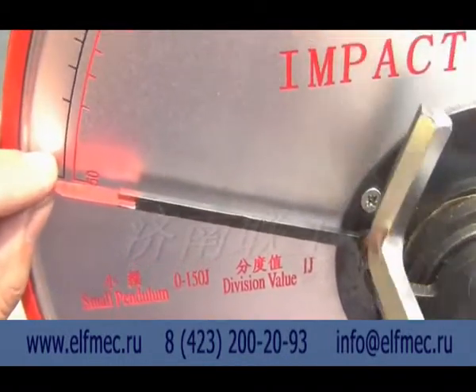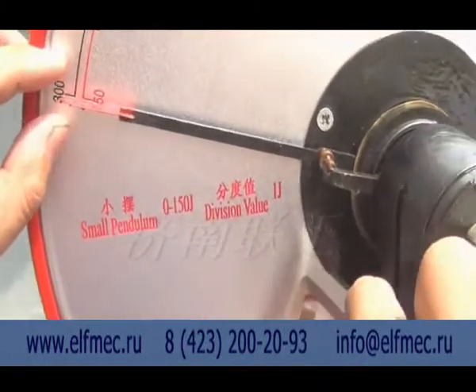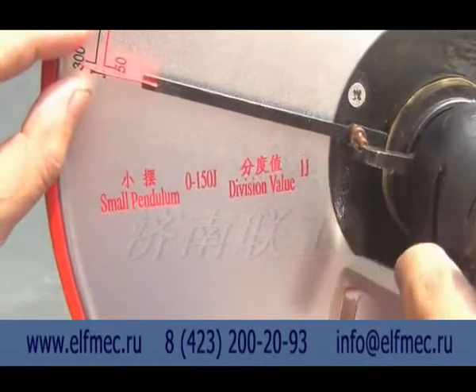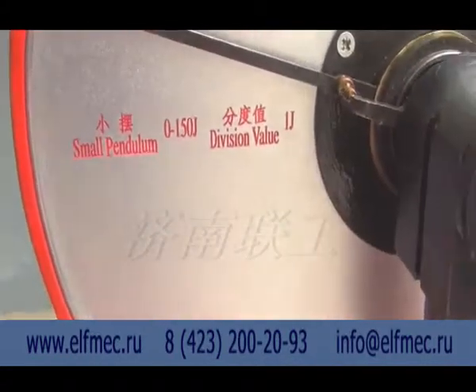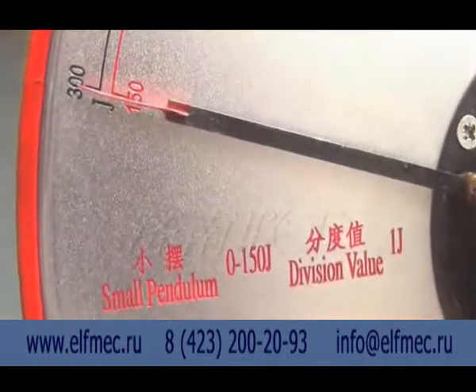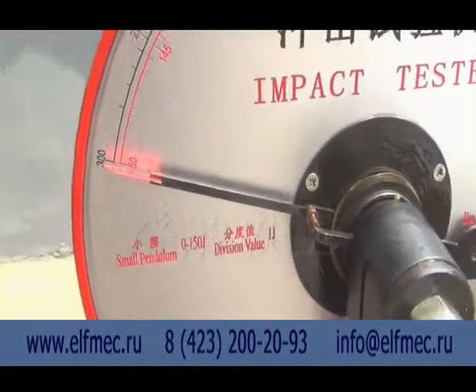Adjust the small pendulum pointer to zero. Firstly, make sure the pendulum is in the vertical position and motionless, and pull the pointer to the maximum energy line. Use a wrench or hammer to tap the fork slightly. When the pointer presses to the fork, make sure the pointer points to the maximum energy line.